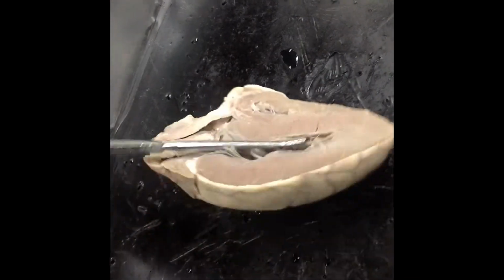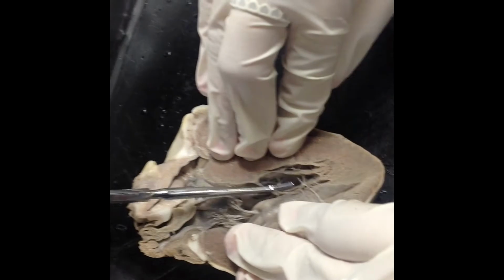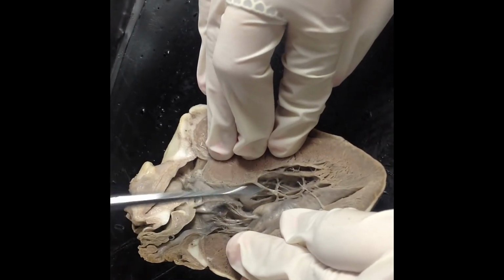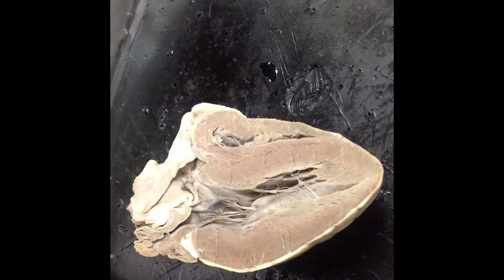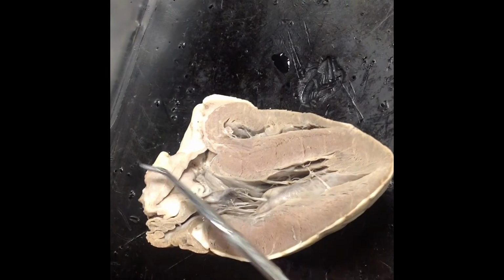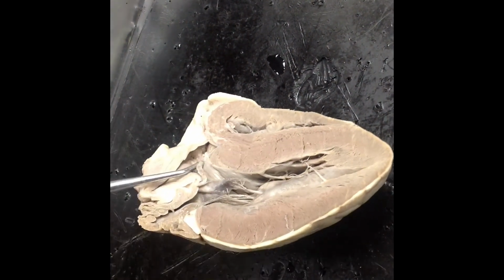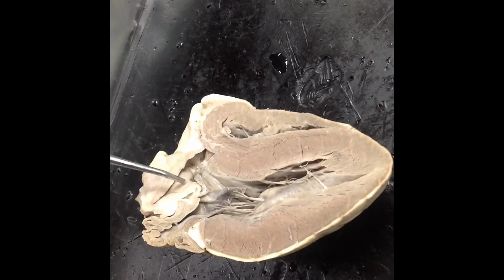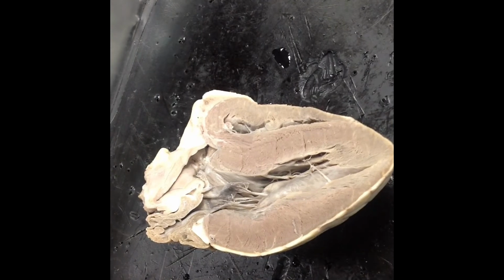Now, if you open it up, can you open it up for me? Look at all this texture. See that rough stuff back here? That's trabeculae carneae. So when the heart contracts, the blood will go from the left atrium to the left ventricle and out this way. This is where the aorta would be. And there's going to be another valve, your aortic valve, that's going to control blood flow. This thin wispy thing that I'm poking at, that's a valve.